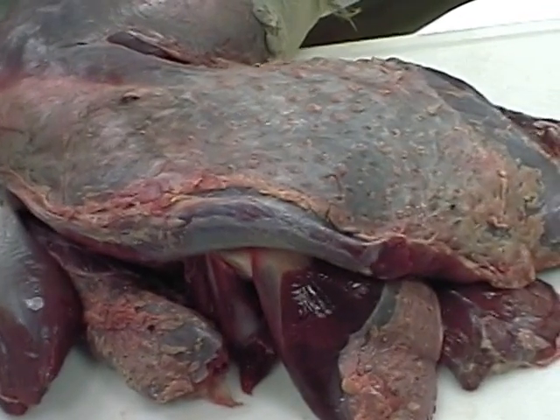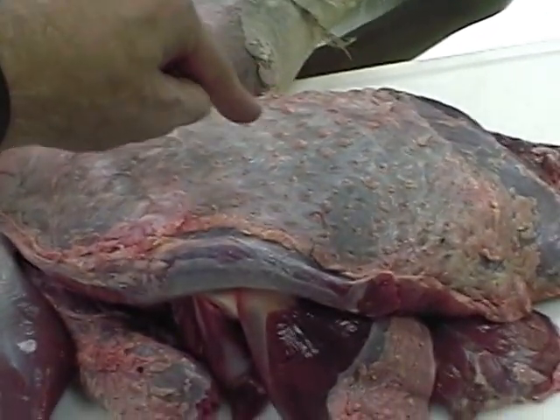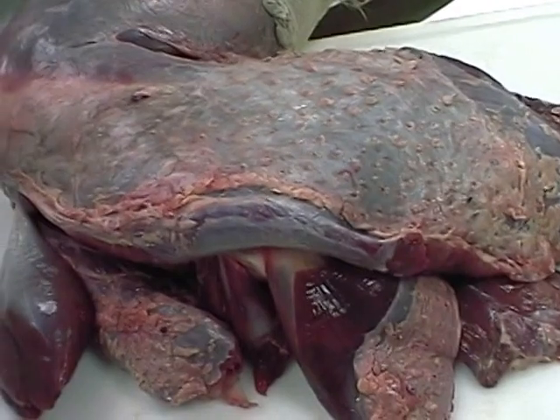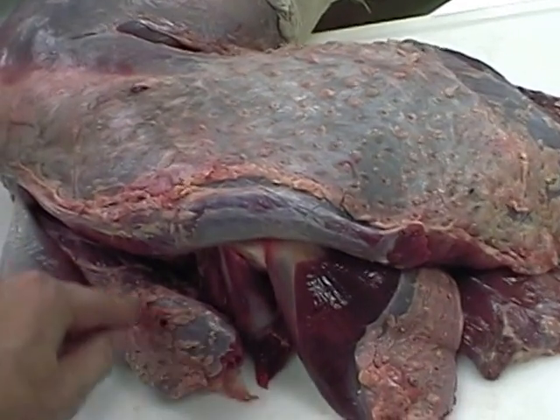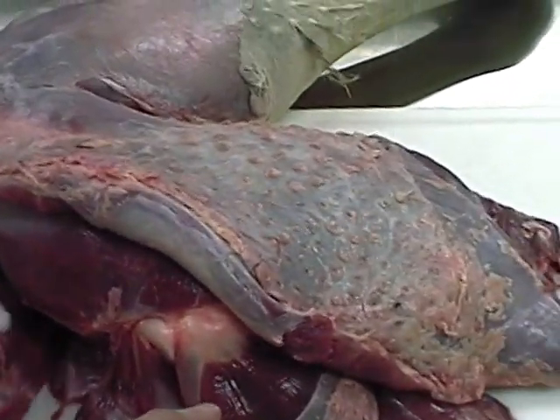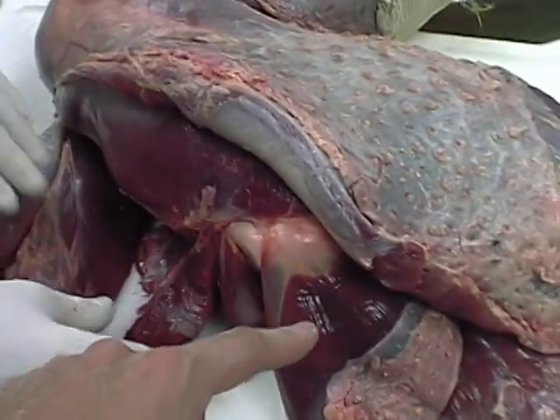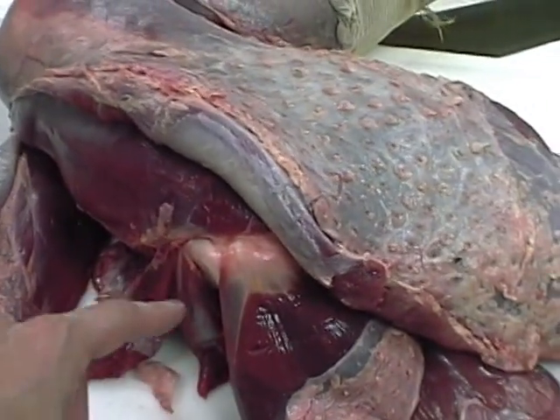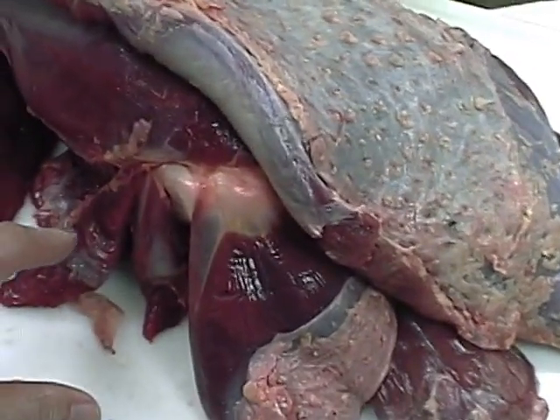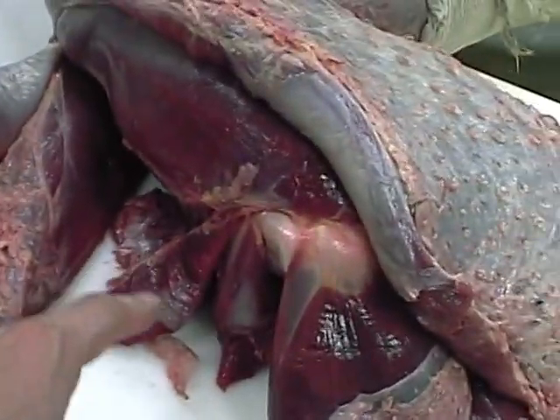The proximal thigh. Here's Iliotibialis lateralis, and here's Iliotibialis cranialis. Beneath those we see Iliotrochantericus caudalis, Iliotrochantericus medius, and Iliotrochantericus cranialis.